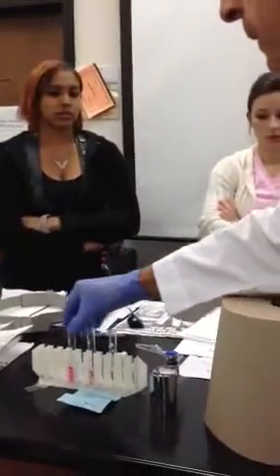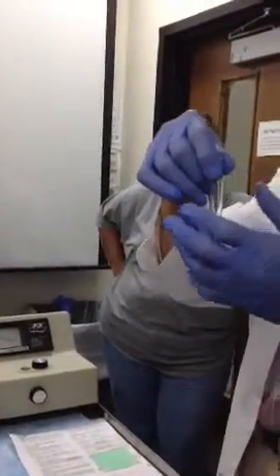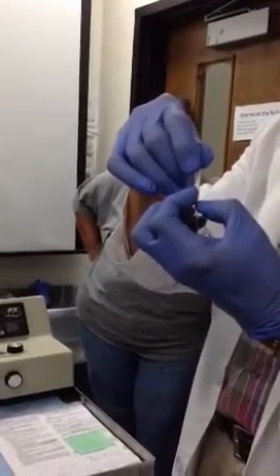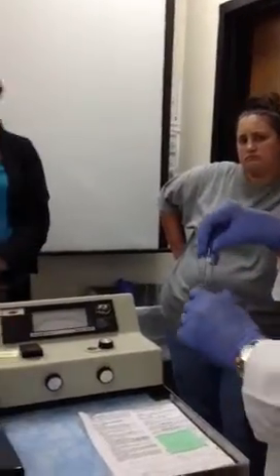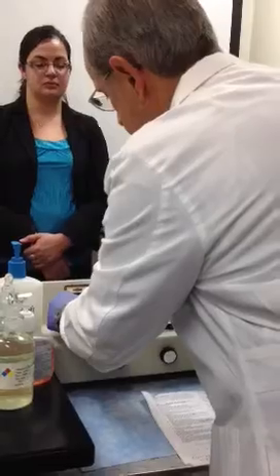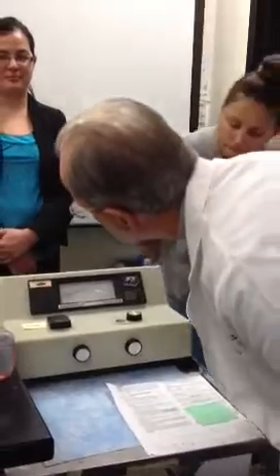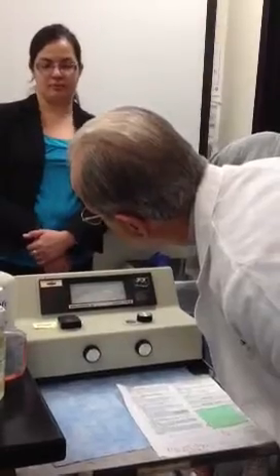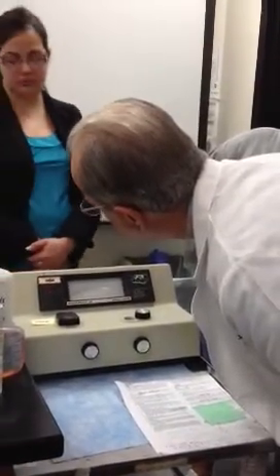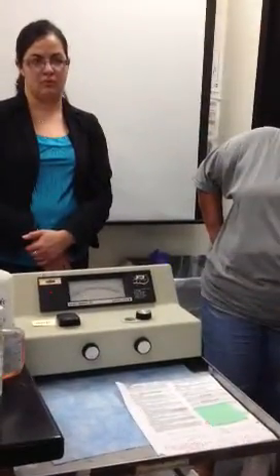Now, over here is our patient sample. And we're going to see what the optical density of this solution is right here compared to our standard. You with me? All right. So let's put this in here. And hello. This is reading 0.98 optical density or absorbance and 10% transmission of light.